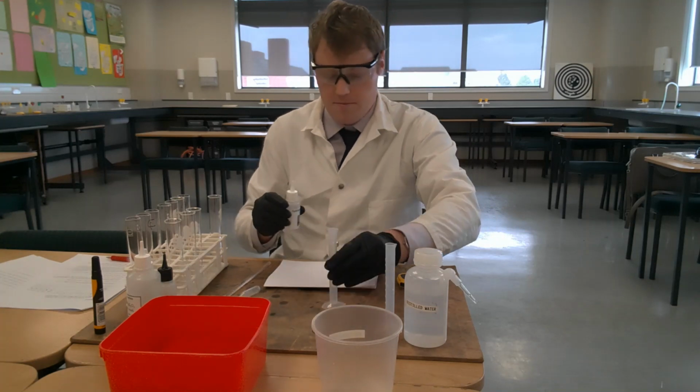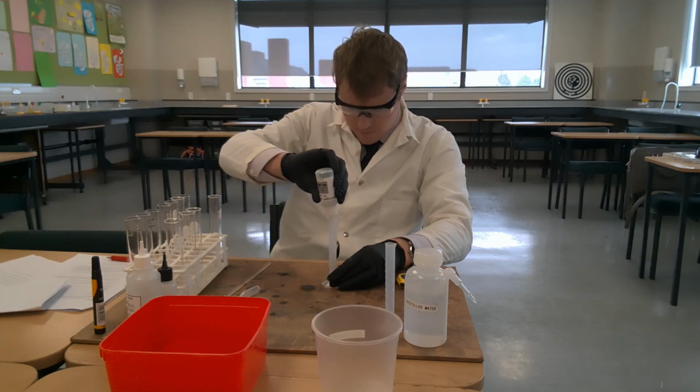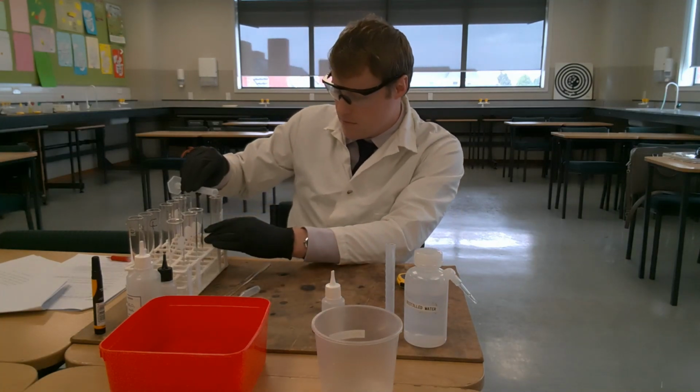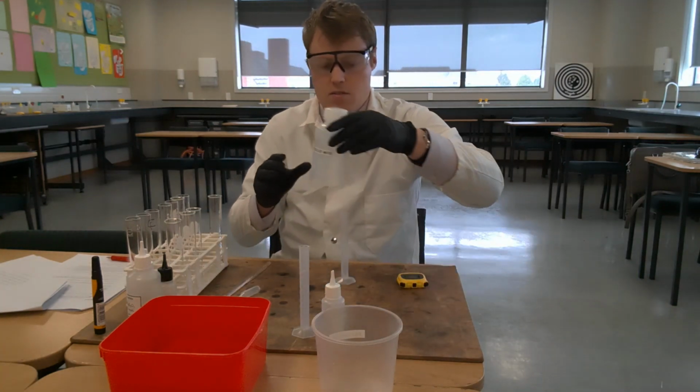2 millilitres of hydrogen peroxide. And 3 millilitres of distilled water.